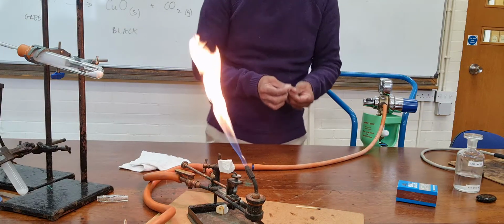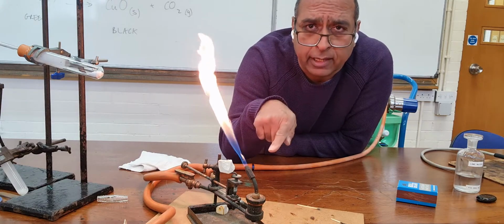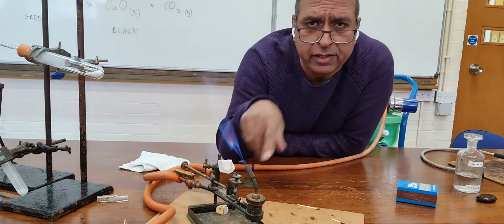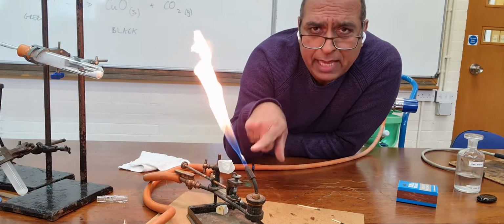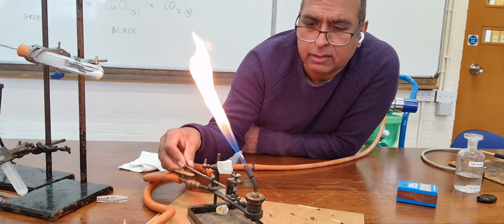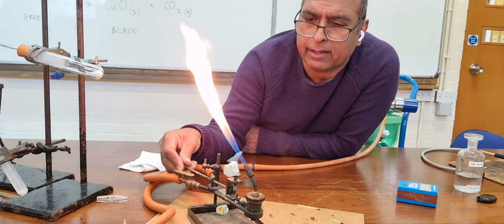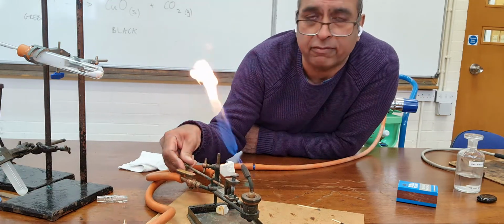Like that. So, that is normal gas from a gas tap that I've lit in this thing which we call a lime burner. So, that solid is lime, and if I turn it round, I'm hoping I can get it in the flame, but it seems a bit low to get in the flame.